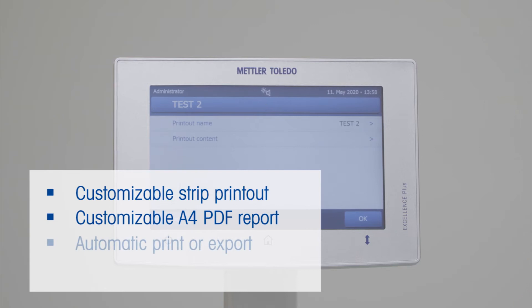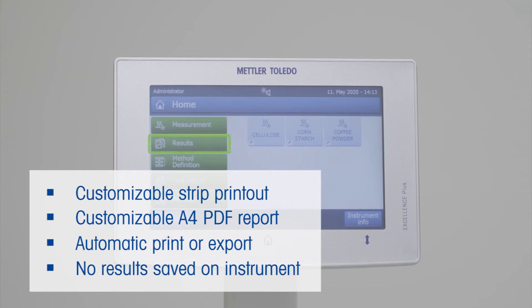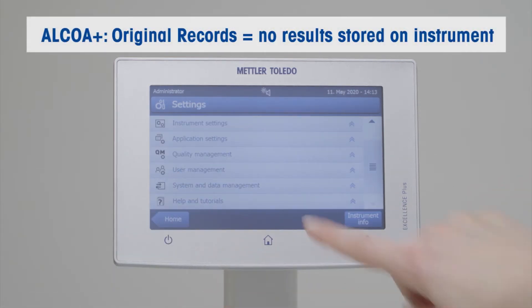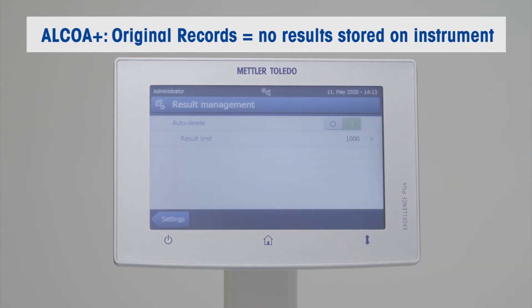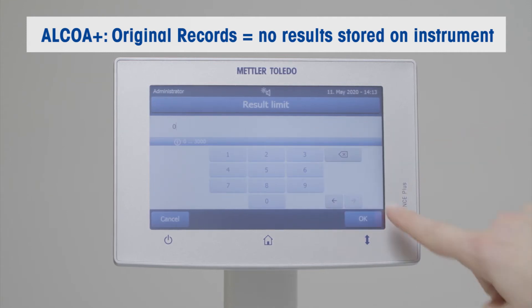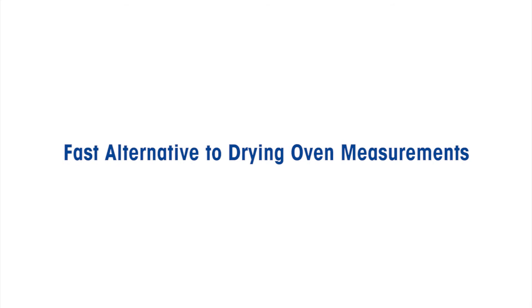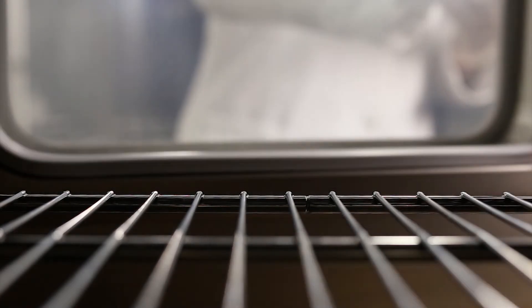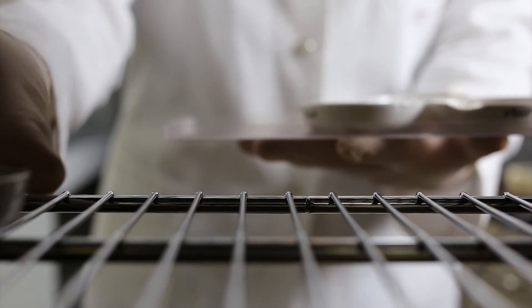The measurement results can be saved locally, sent to a printer, or exported to a network location. If necessary, the instrument will delete the result immediately after exporting in order to keep no local records.